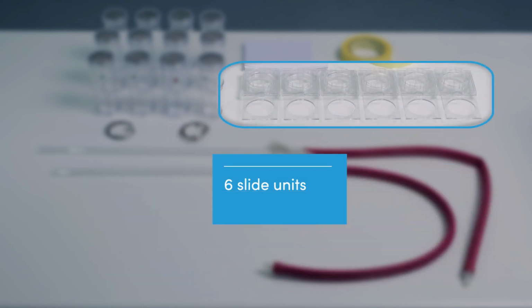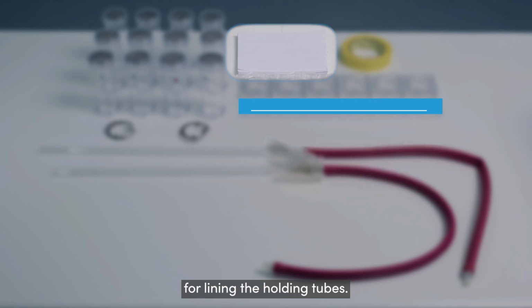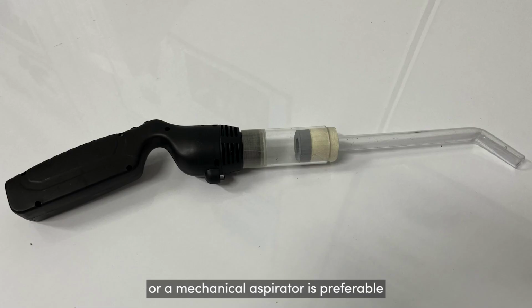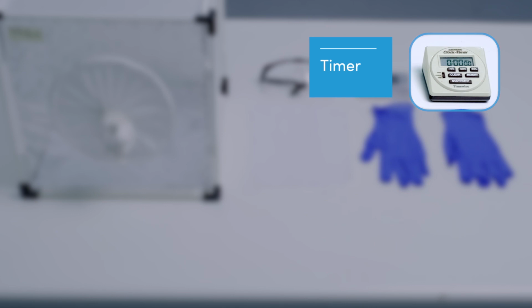6 slide units, 6 sheets of 15 by 12 centimeter white paper for lining the holding tubes. Aspirators. A mouth aspirator with a HEPA filter or a mechanical aspirator is preferable to avoid any exposure to insecticides or inhalation of allergens. Netting pieces. A timer.